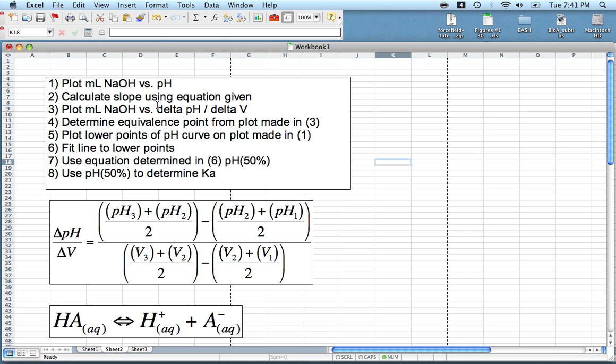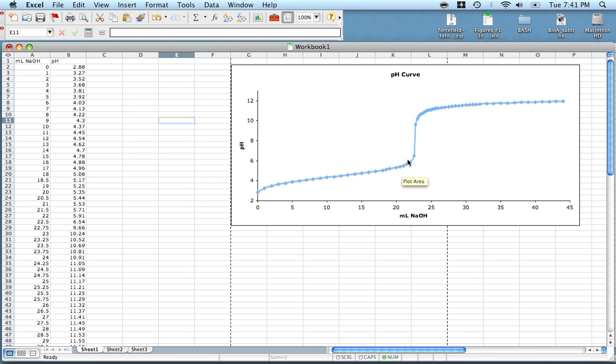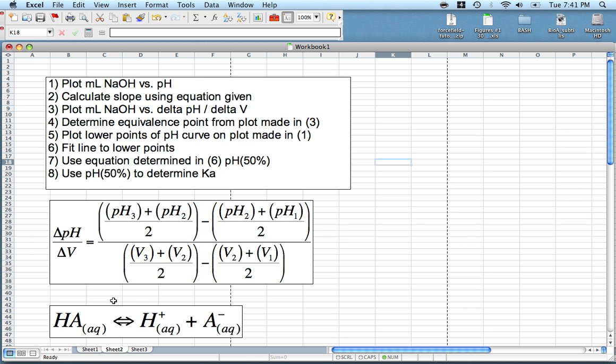The second thing we want to do is calculate the slope using the given equation. This equation is just the first derivative, or the slope, at any one of these given points. If we took the first derivative of each one of these points, the equivalence point will be the point on this curve where the slope is the greatest. So just keep that in mind.